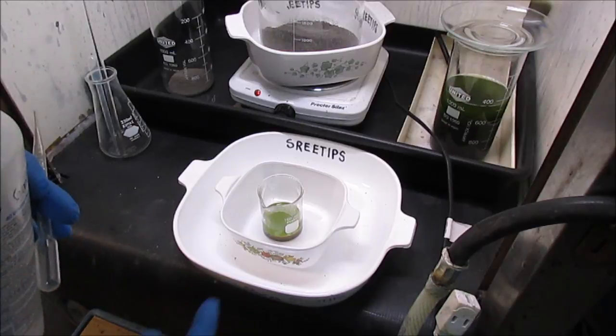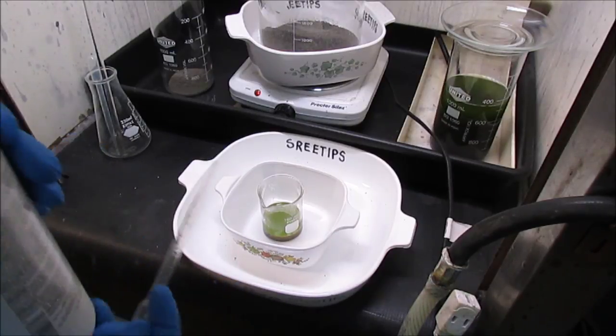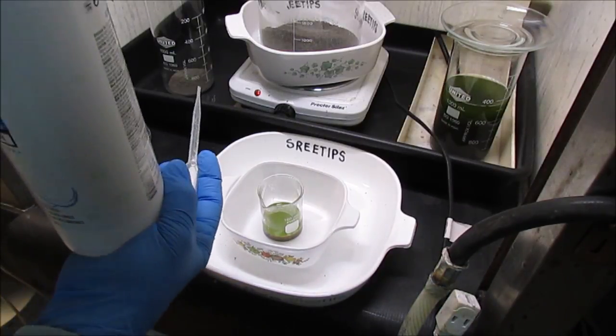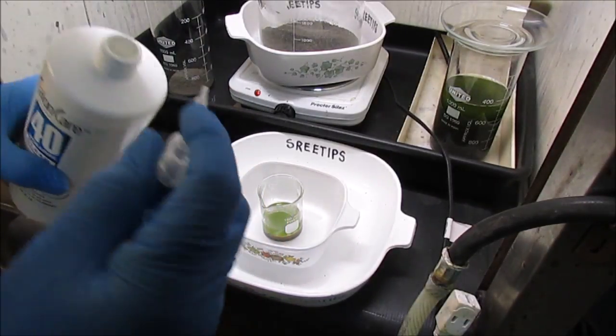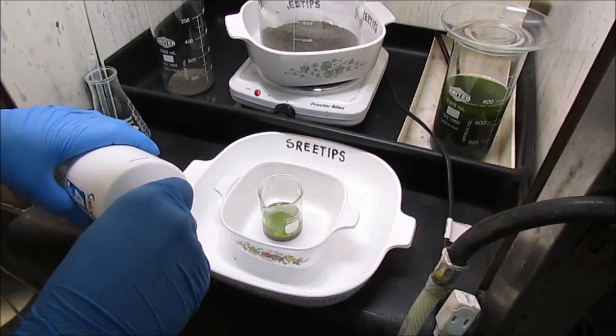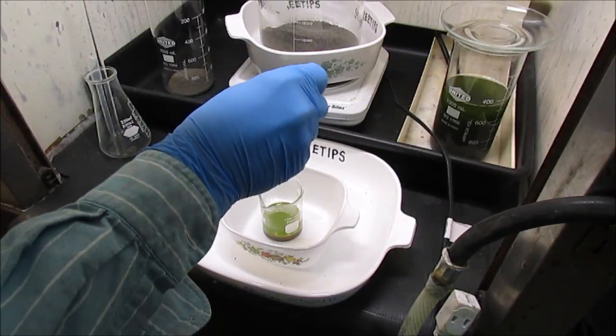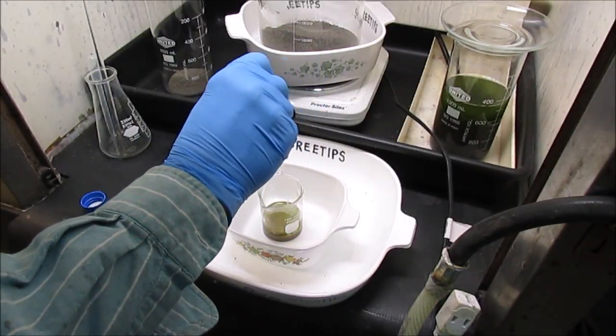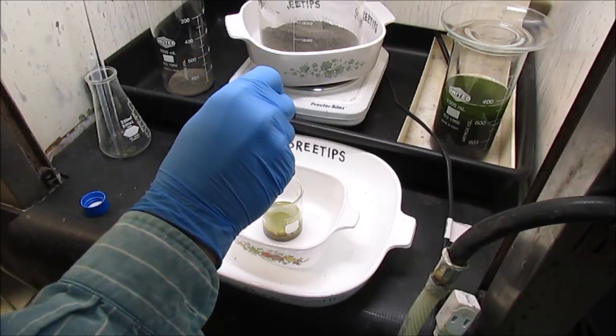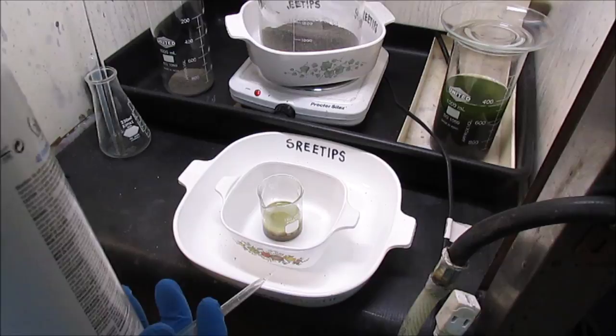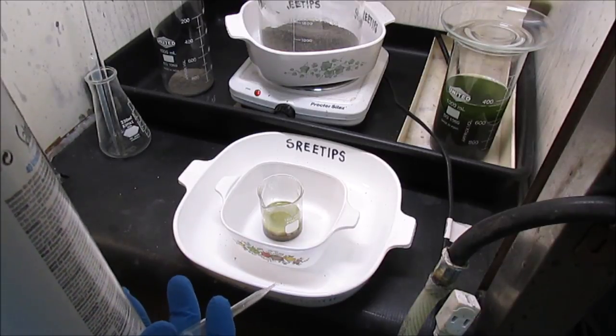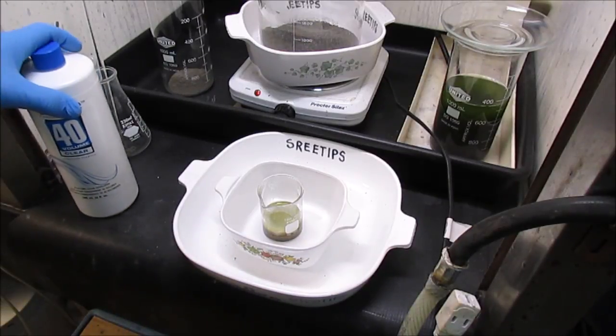Alright, I started out with about 10 ml of sulfuric acid in there. I've added a whole bunch of the hydrogen peroxide. I don't know how much I put in there, but if I add some more, I notice that nothing happens now. So the reaction must have completely ate up all the chemicals in there.